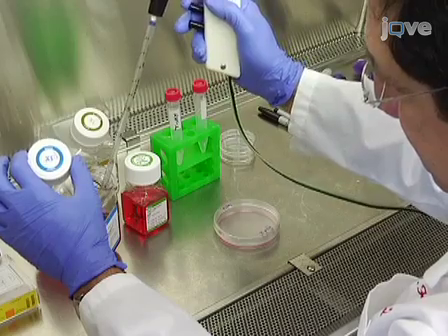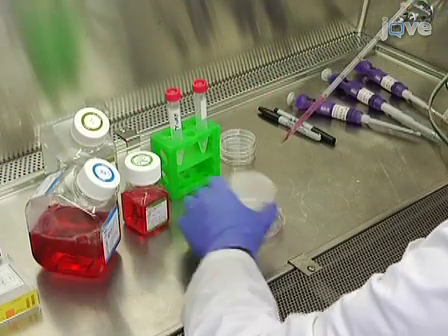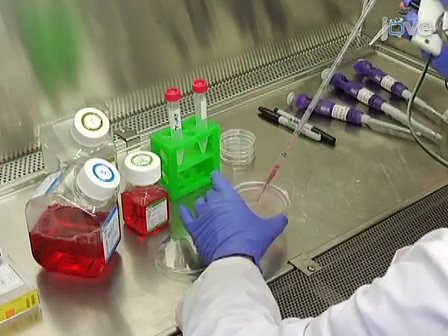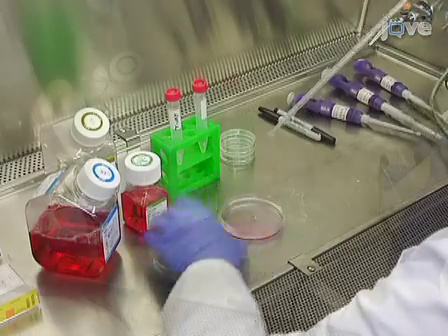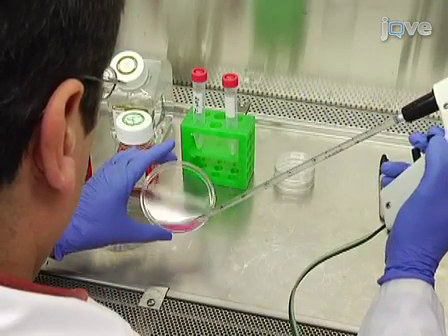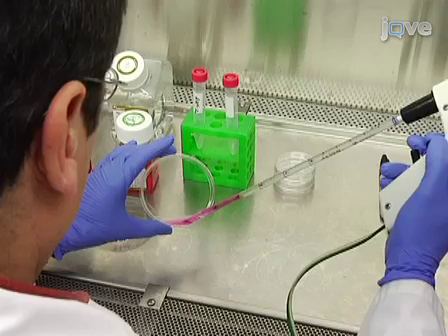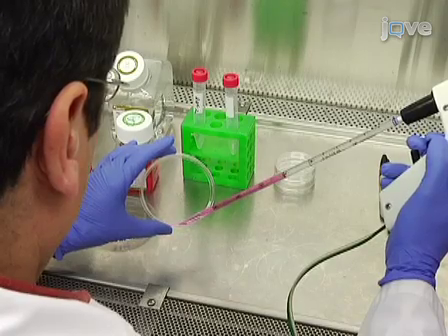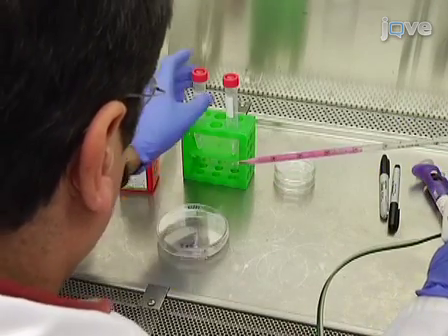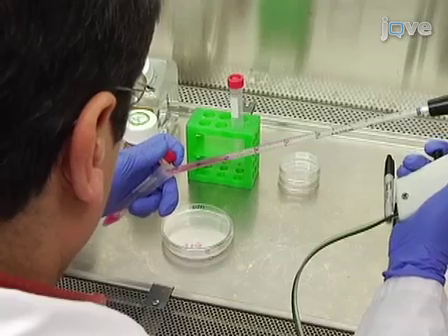Next, remove the plate from the incubator and halt trypsinization by adding 2ml of complete medium. Use a 5ml pipette to triturate the mixture until the cells are fully in suspension. Then transfer the cell suspension into a 15ml conical tube.